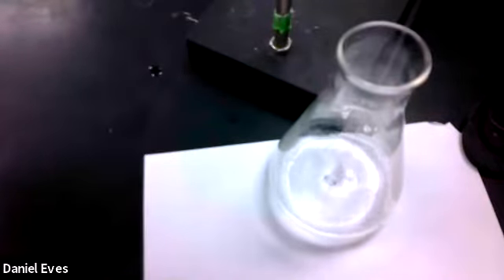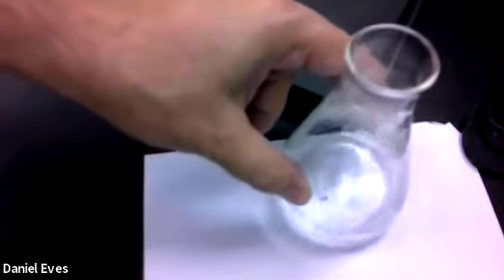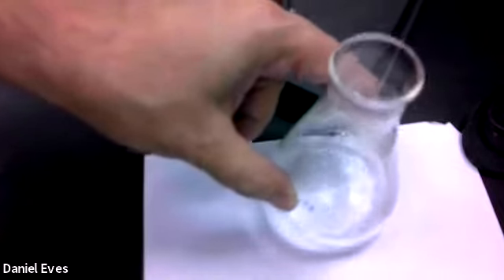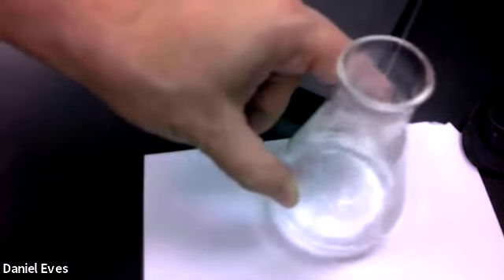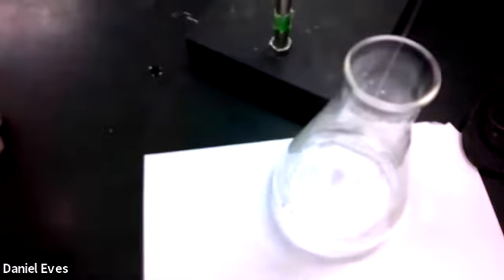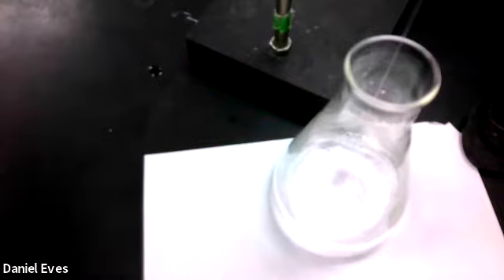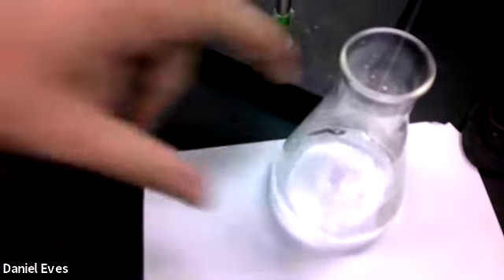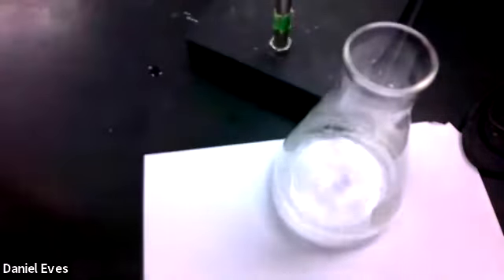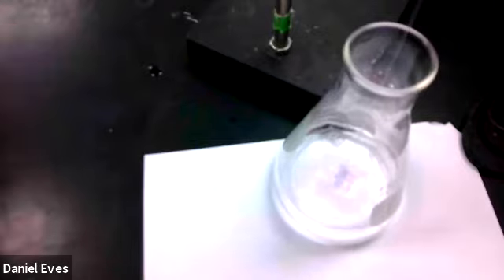So here we go. So the amount of acid that we added to this was the same 0.2 grams, but it's a different acid. So it's probably going to take a different amount of our sodium hydroxide solution.